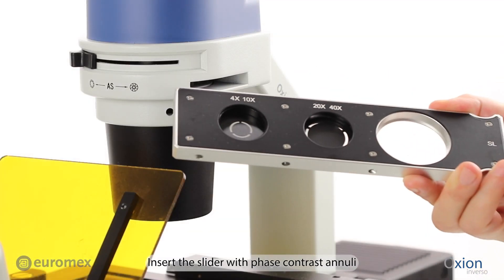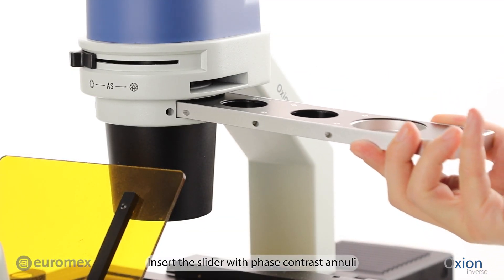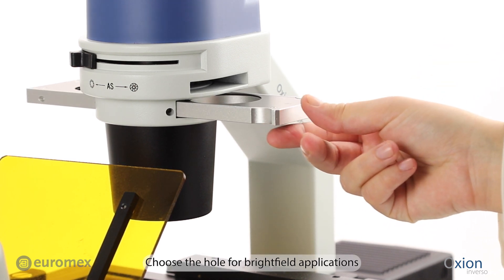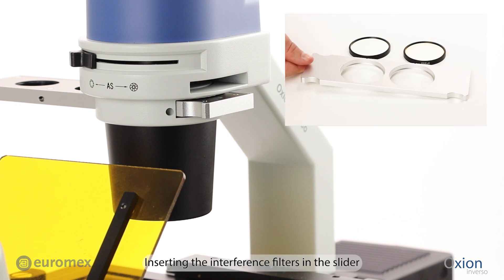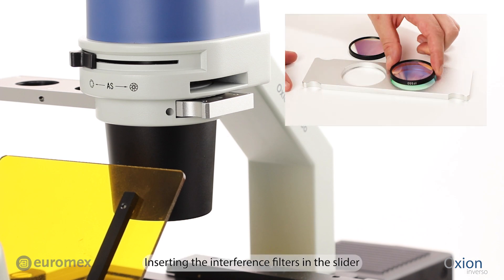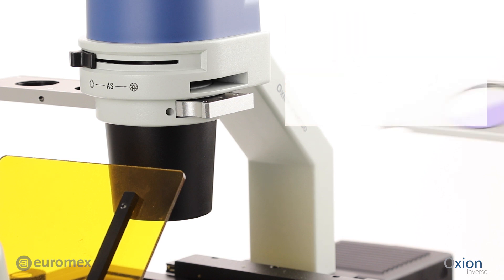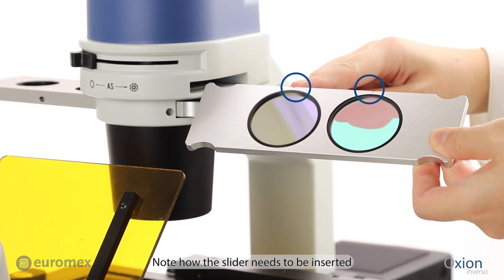Insert the slider with Phase Contrast Annuli. Choose the hole for Brightfield Applications. Inserting the Interference Filters in the Slider. Note how the slider needs to be inserted.